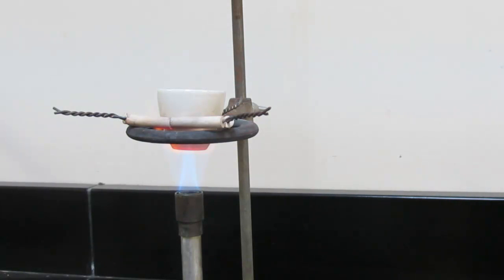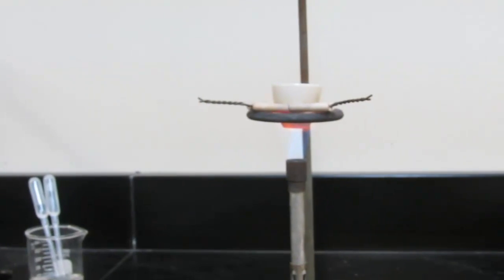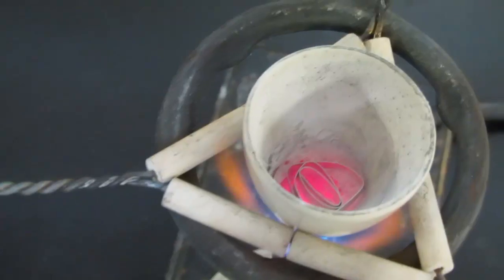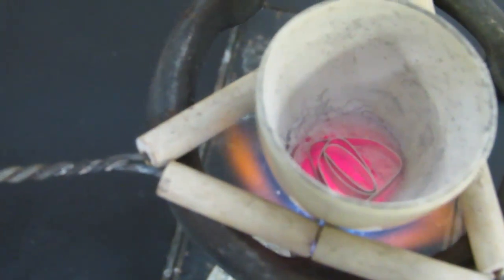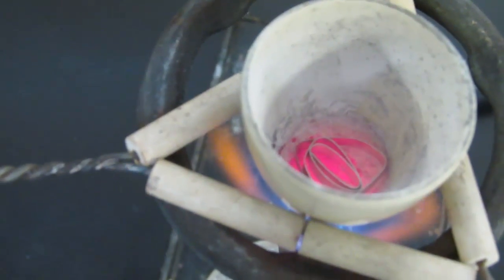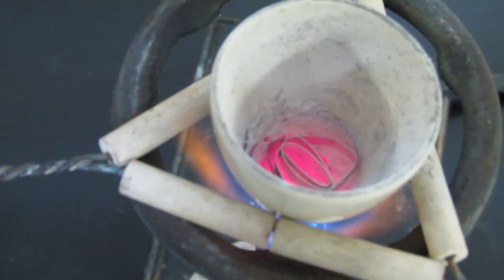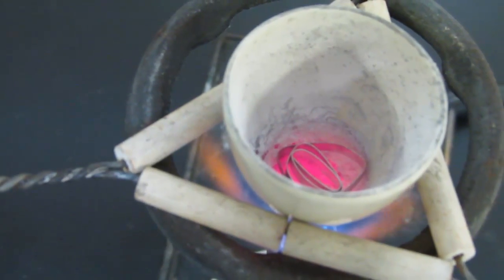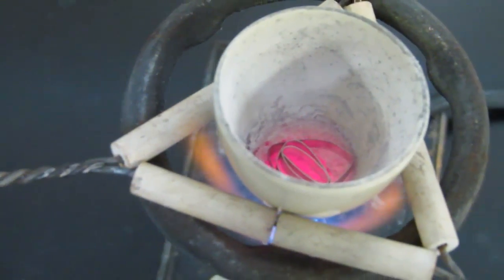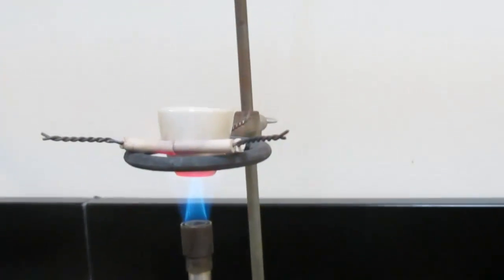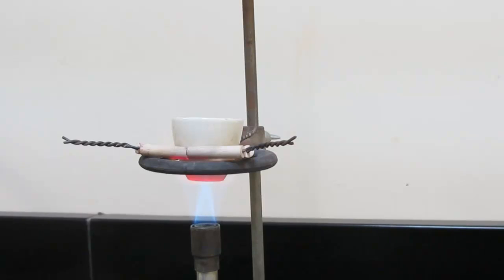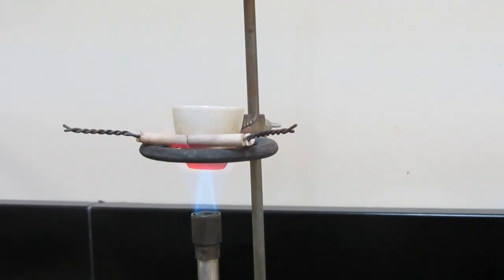And we'll take a view from the top again. And you can see it's nice and red hot on the side there. Nice and hot, and we'll get that to react with the air in the room here, hopefully before long.